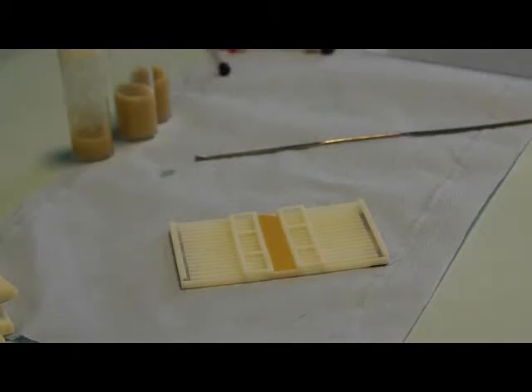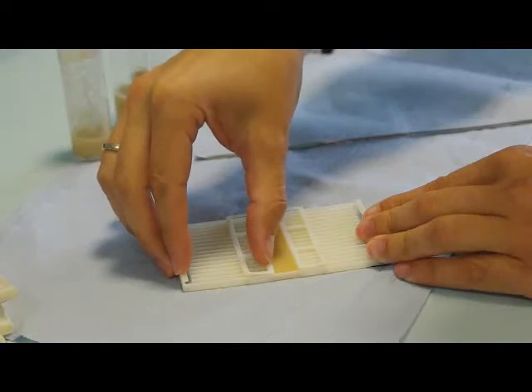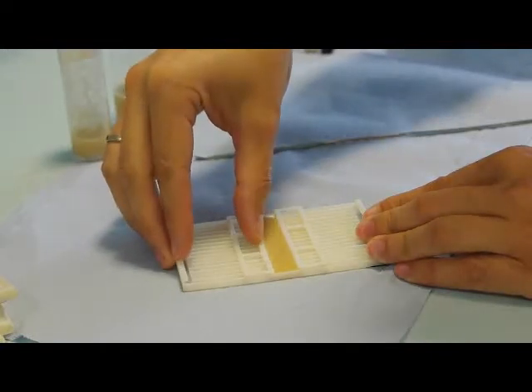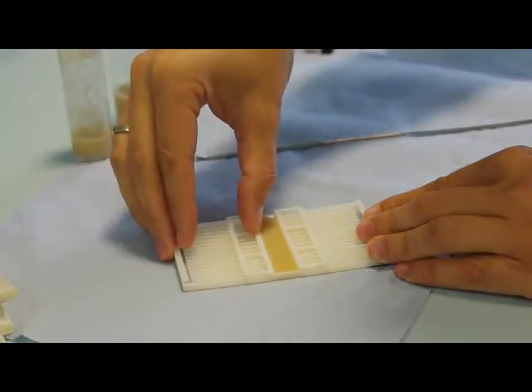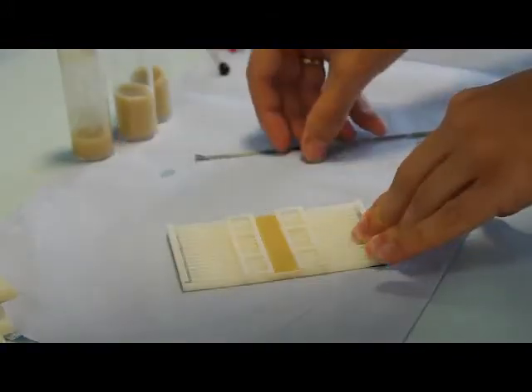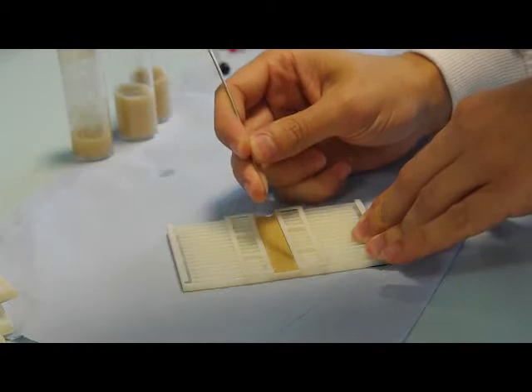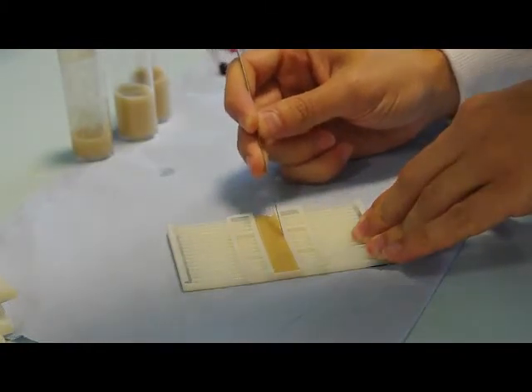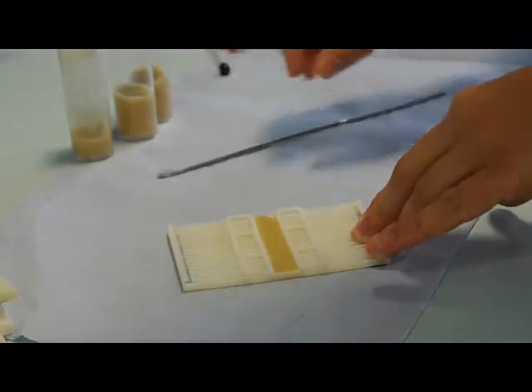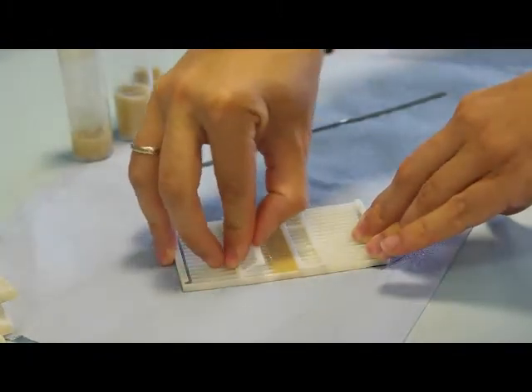Once the food is solid again, you will have to gently remove the two containing walls. Simply use your fingernail to distance the walls from the food. You might also want to use something thin and sharp to cut along. With a gentle movement of your thumb, remove the wall.